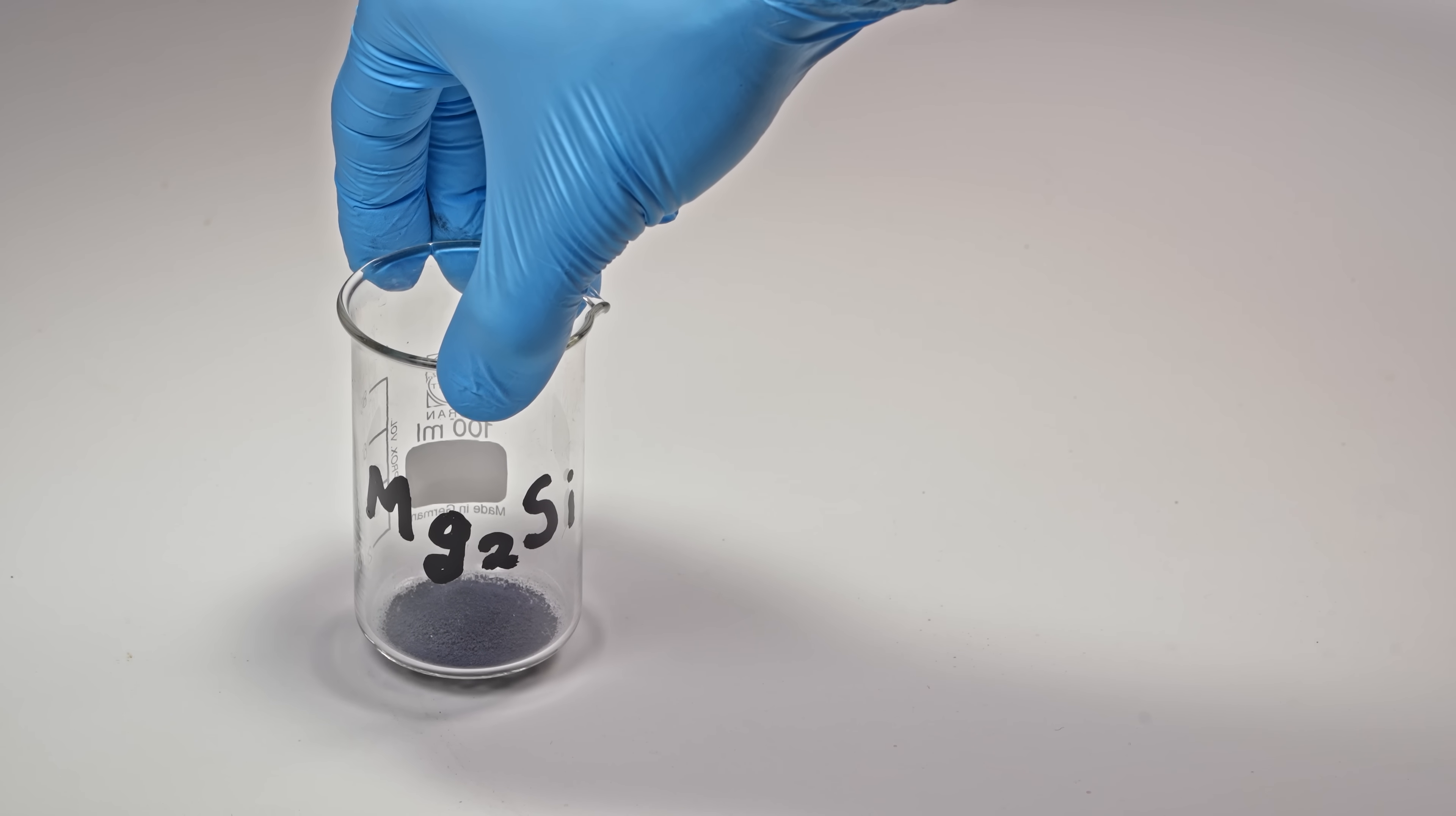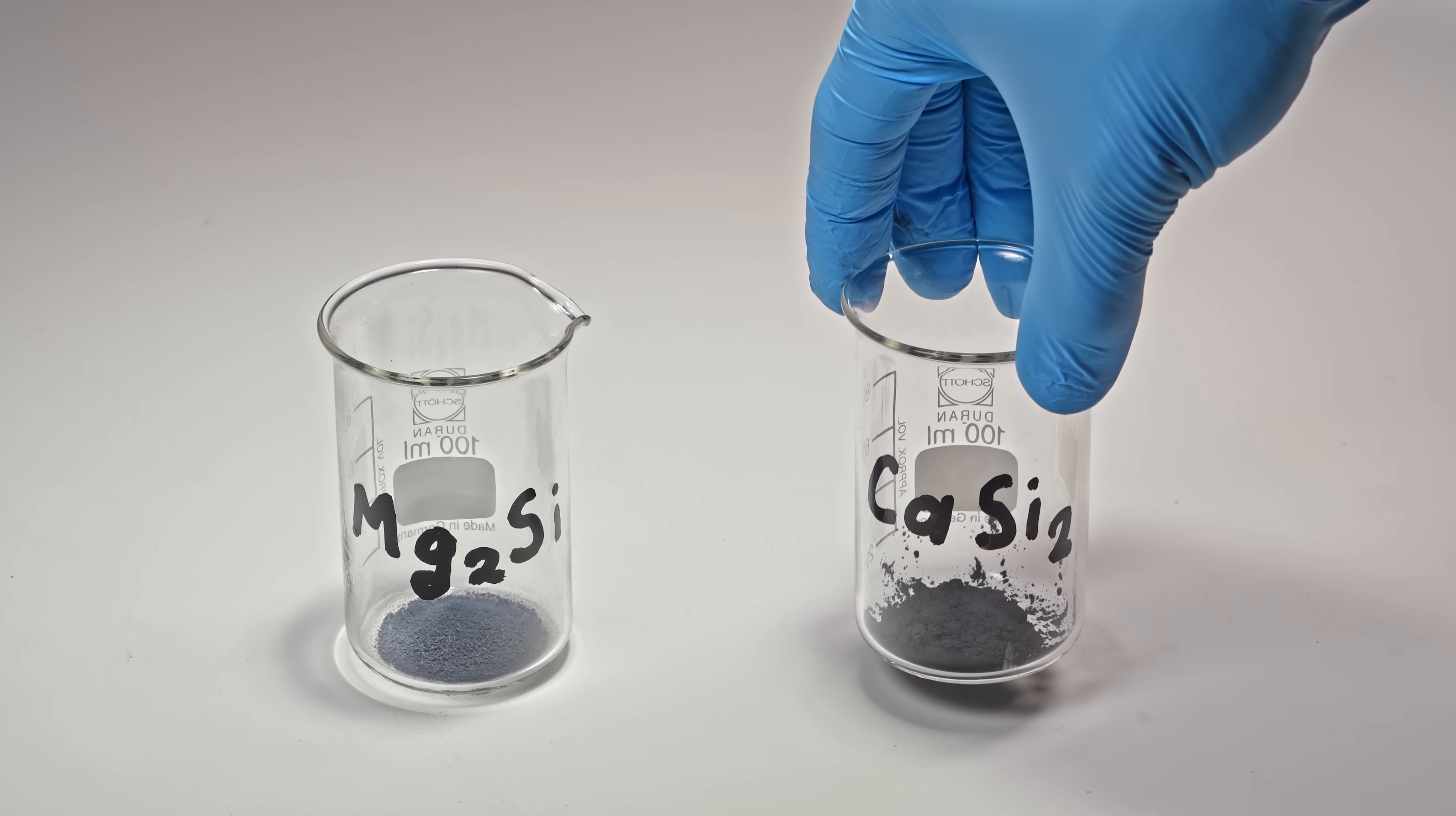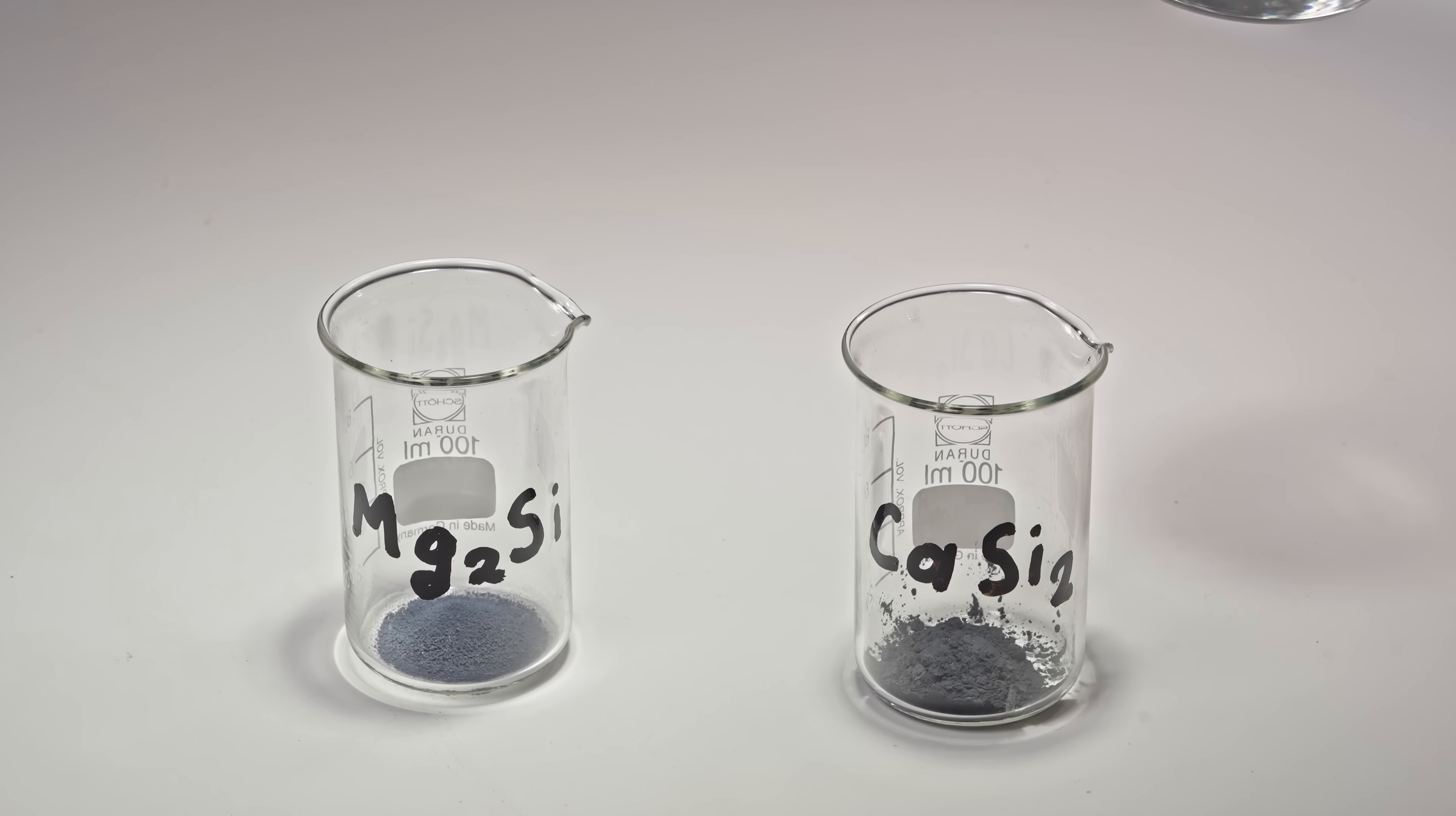Hey guys! Look at these grey powders! The first glass has magnesium silicide, and the second one has calcium disilicide, and here is some hydrochloric acid.